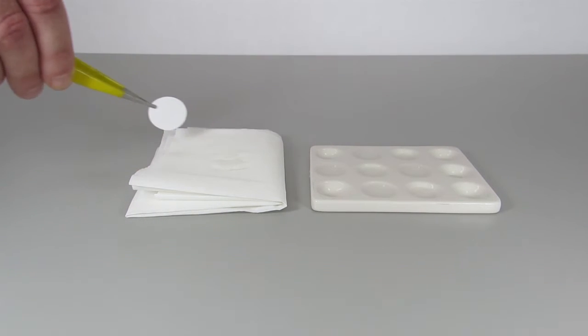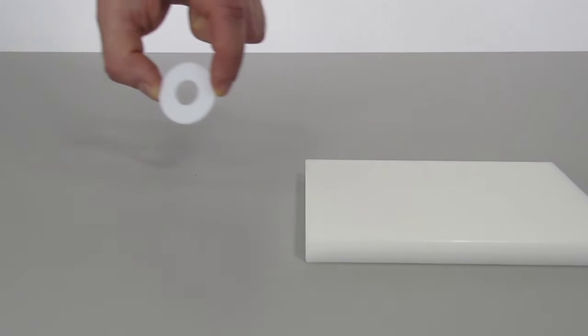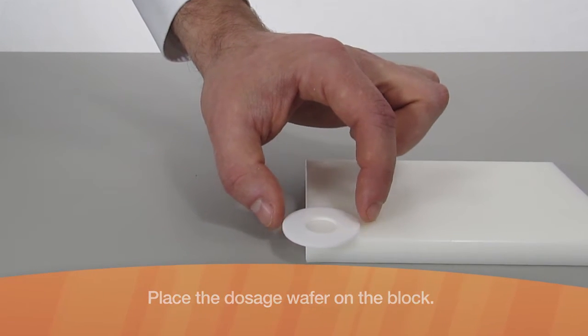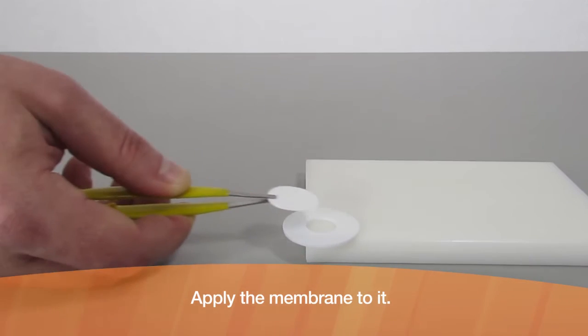Place the dosage wafer on the block and apply the membrane to it.